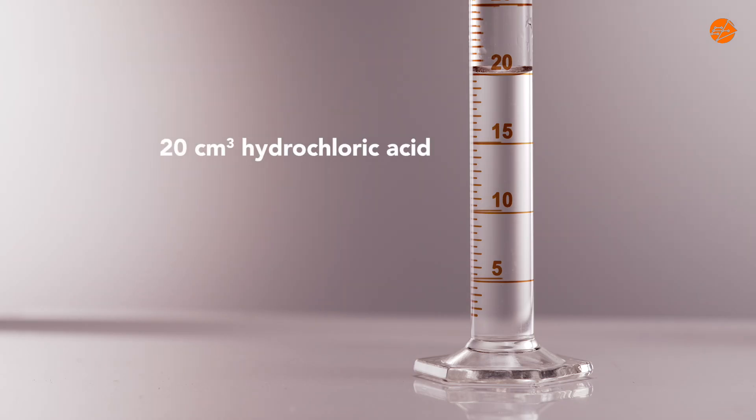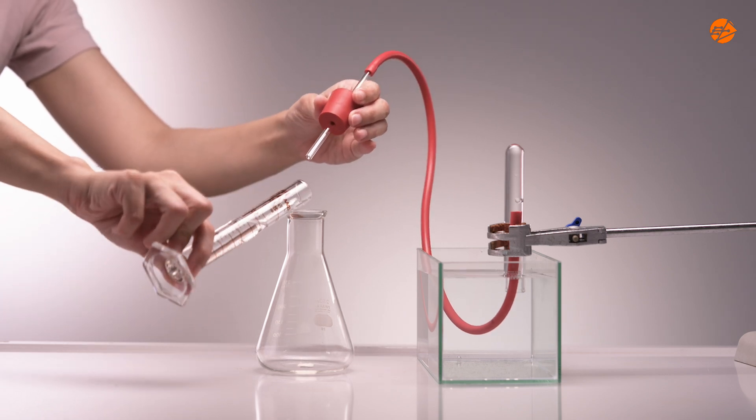Transfer 20 cm³ of hydrochloric acid into a conical flask.